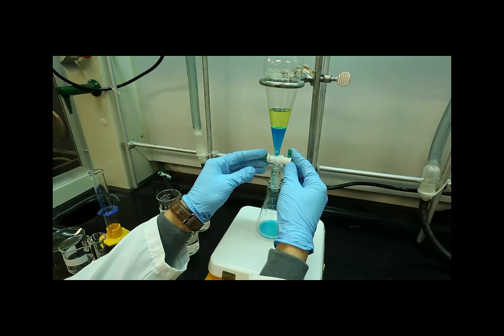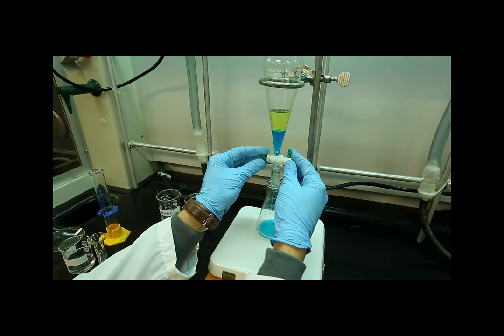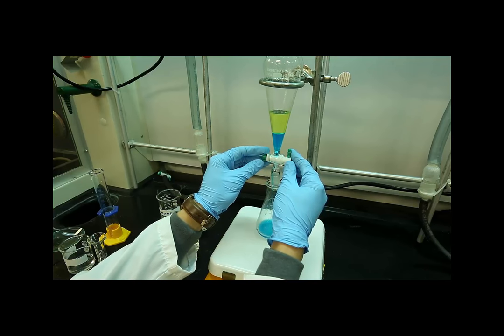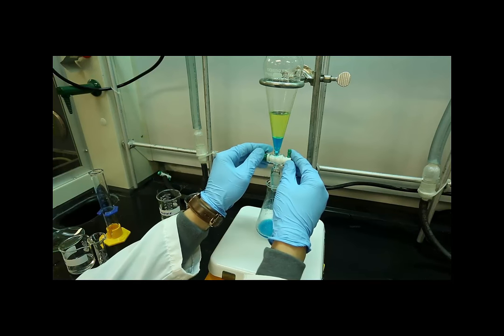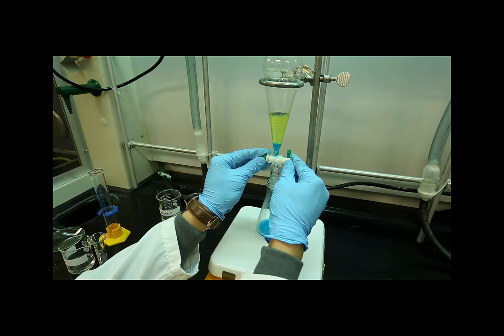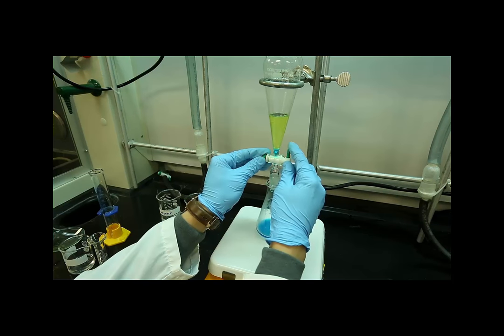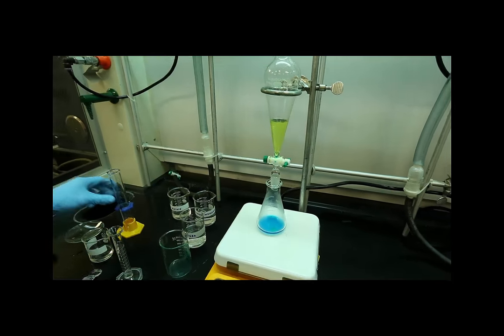If this was an extraction, we would have started the same way with the ethyl acetate solution, and then in adding the second solvent, we would keep that resulting solution, since we may want to keep the blue compound.